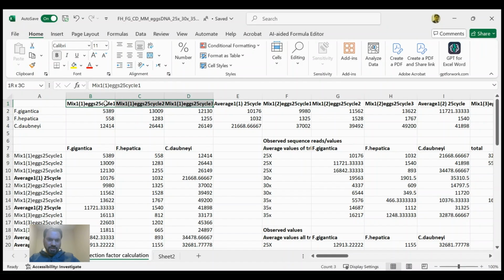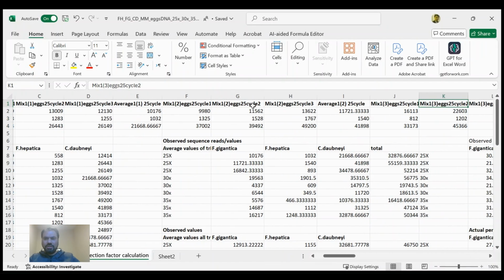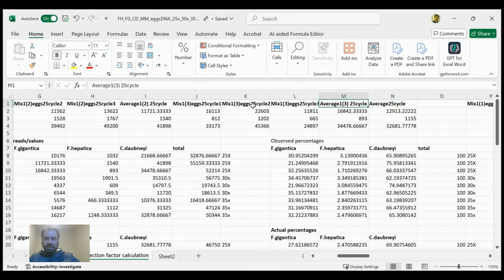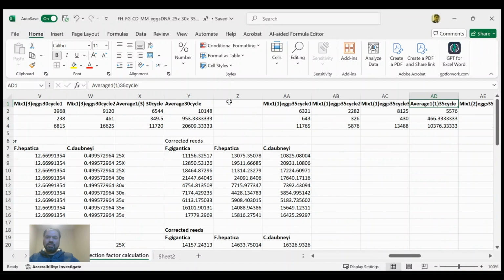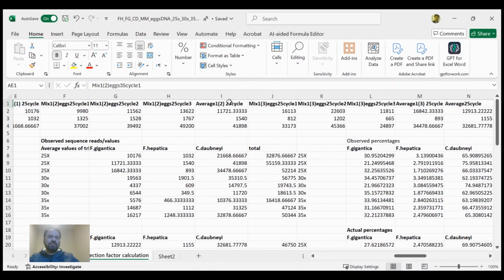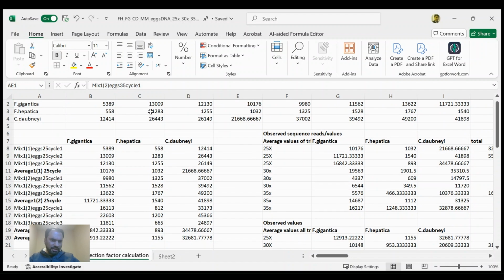Here you can see the first samples are from the 25 cycles, and then we have taken the average of the first triplicate, and likewise in the second triplicate we took the average, and in the third triplicate we took the average, and then finally the average of all 25 cycles in the final column. And likewise we did with the 30 cycle and 35 cycle runs. In this way, first of all, we need to sort out our data in regular columns, so that we can make further analysis with ease.